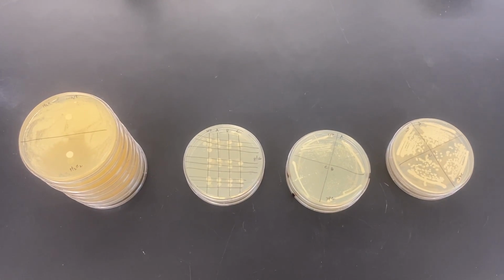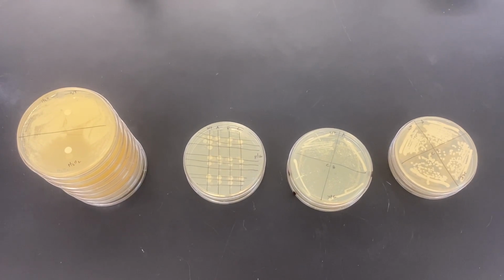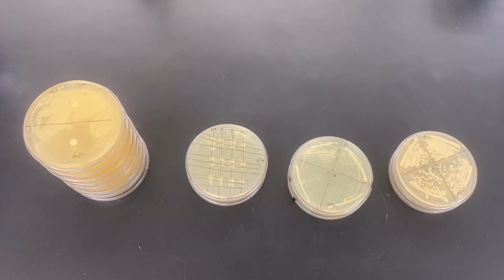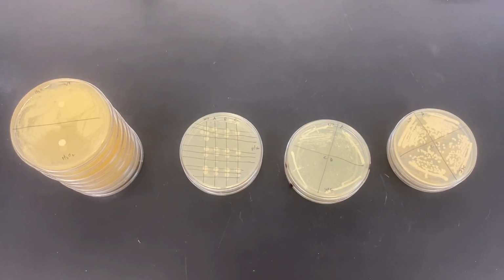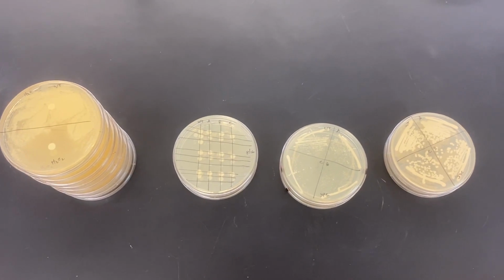So we started off with cells that were genetically uniform. We exposed them to ultraviolet light, and so any significant differences in the phenotype or the way they grow would have to be due to a genetic change, because they've otherwise been exactly the same up to that point. So I'll just go ahead and film one video that shows you all the different tests that we did and the results of those.